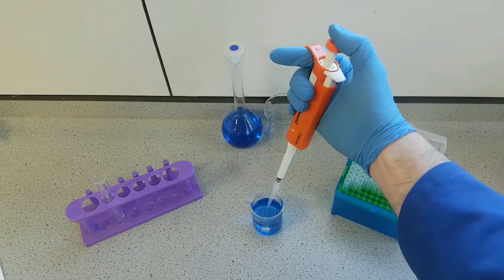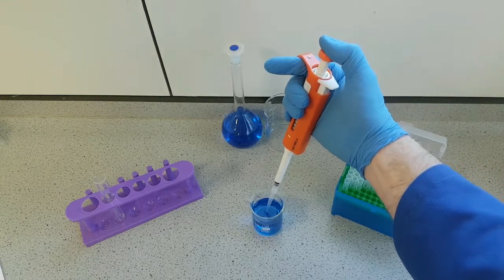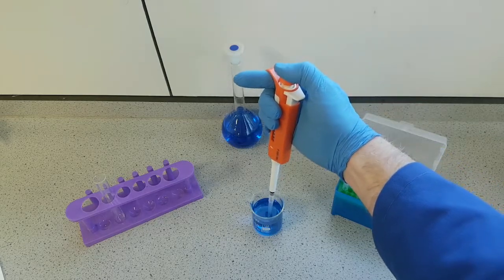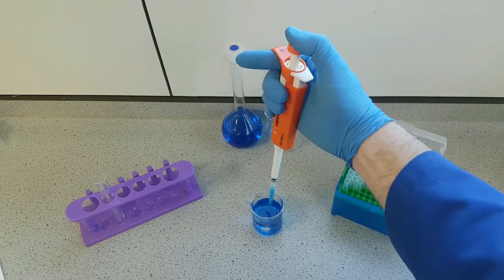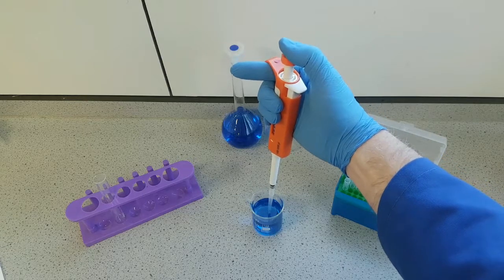Some auto pipettes require you to pre-wet your pipette tip three times. To do that, we just draw up our solution three times.